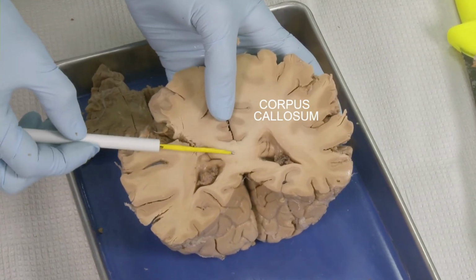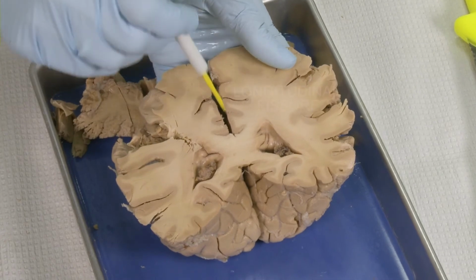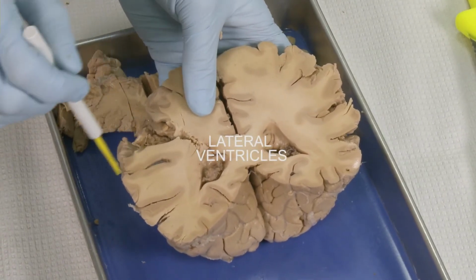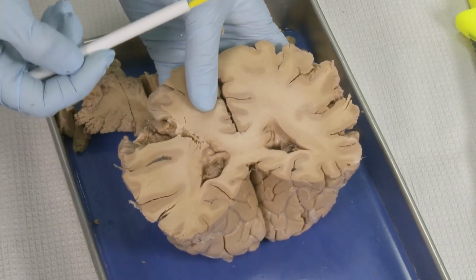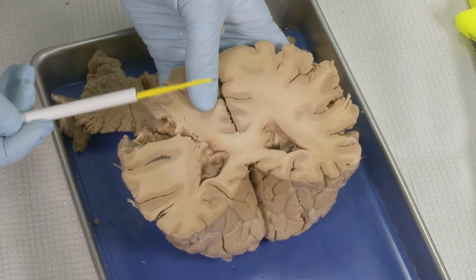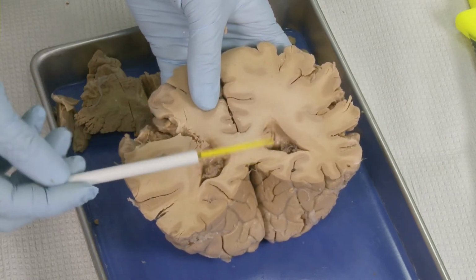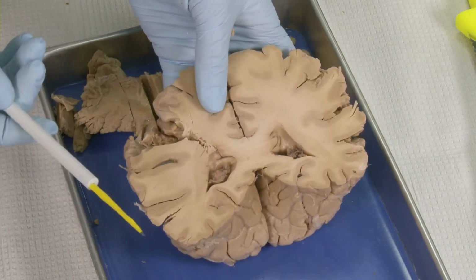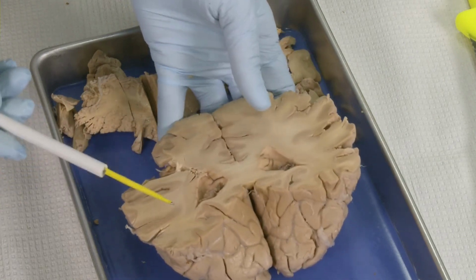The corpus callosum at this level is called the splenium, and you have here a longitudinal fissure. This is the lateral ventricle, and at this level we passed the basal ganglia, thalamus. In the previous section we also saw some subcortical structures. So this is the far back of the cerebral hemisphere, how it looks, and this would be the end of our dissection.